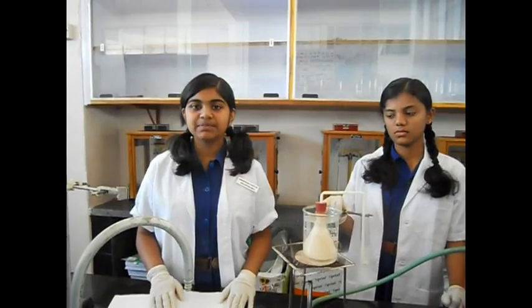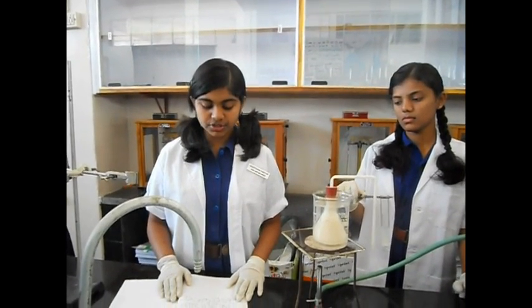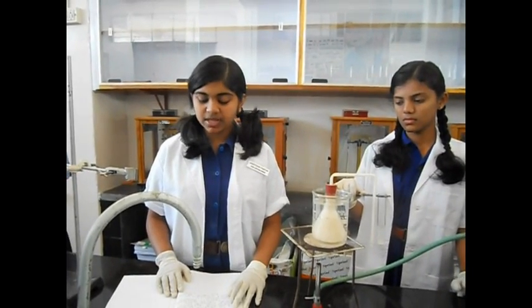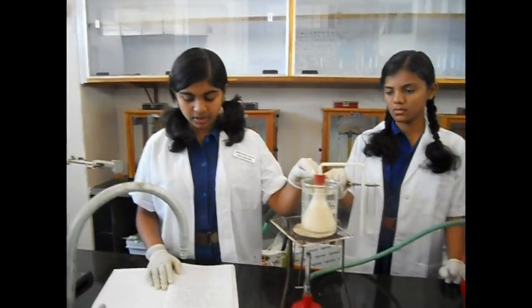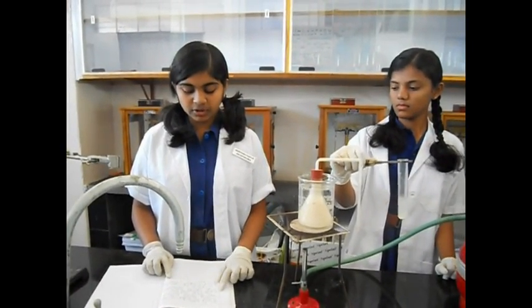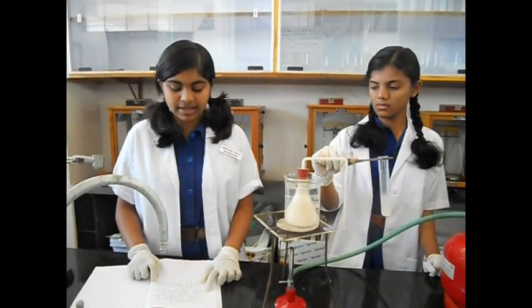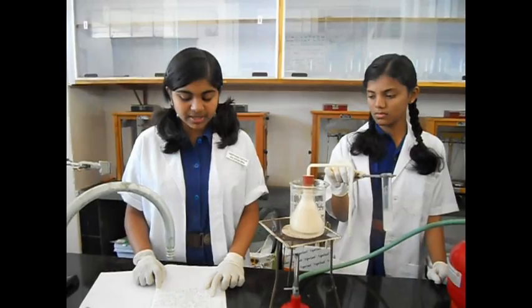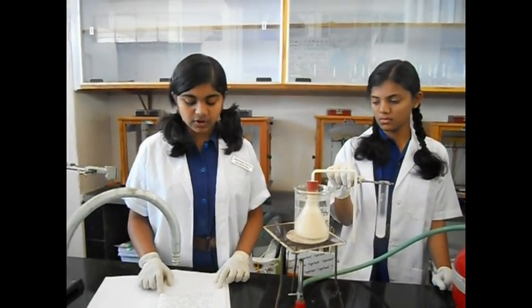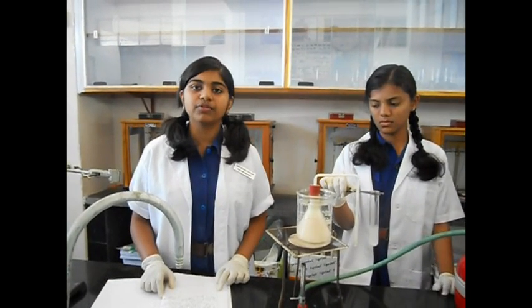From this experiment, we get to understand that when the mixture of glucose solution and yeast are heated, an enzyme zymase is produced by yeast. This converts glucose into ethanol and carbon dioxide. Carbon dioxide reacts with lime water to form insoluble calcium carbonate salt, which makes the solution milky white. Ethanol that is formed in this conical flask can be distilled to obtain it in pure form.